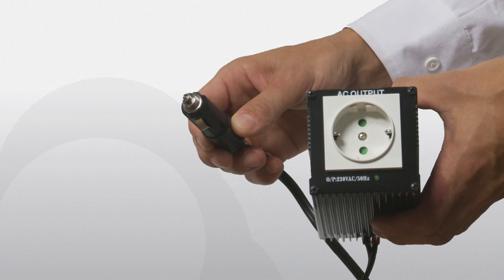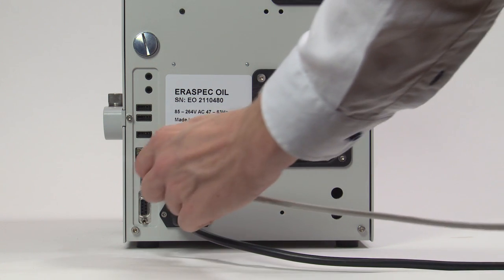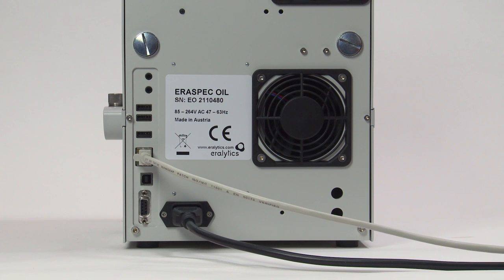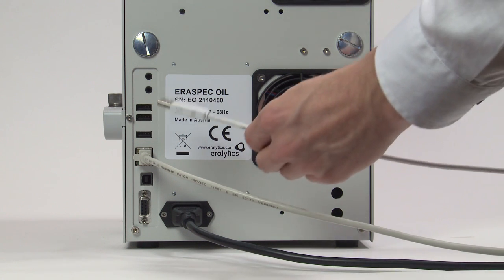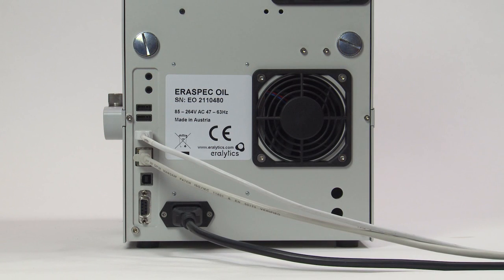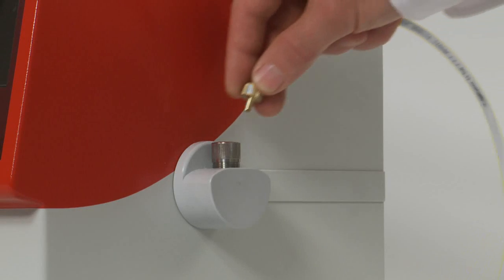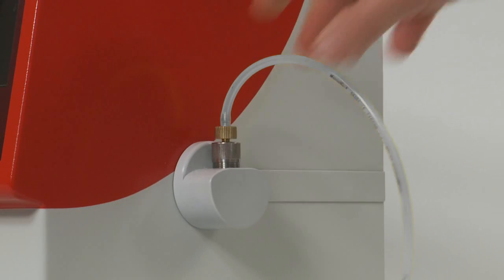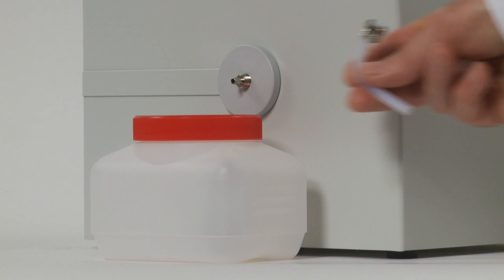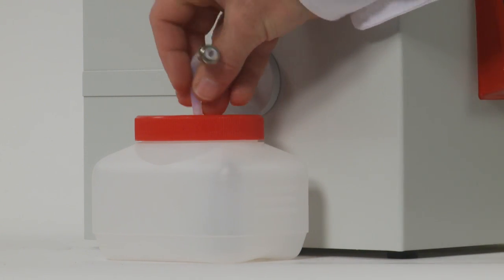For data transfer or remote control, the unit can be connected to a network by the Ethernet interface, or directly to a computer or printer using the USB ports. Put the inlet tube in the Luer inlets on the right side of the instrument, then place the waste container next to the instrument and connect the outlet tube to the outlet on the left side.